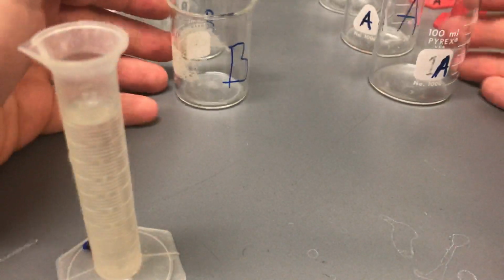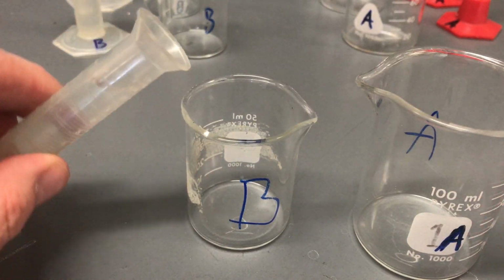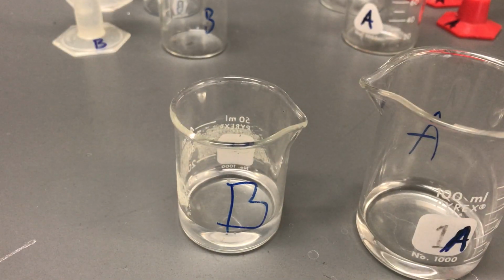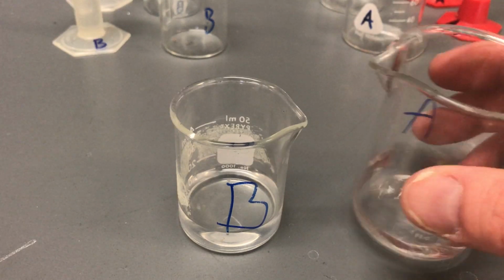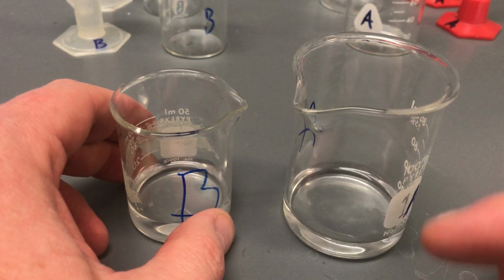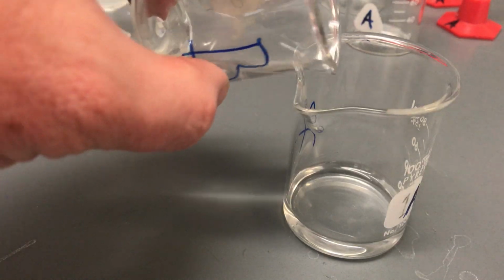And so we will bring those beakers in closer. I have my 10 and 10 now. So now this is, for example, an 80% solution over here because it was 8 milliliters of the solution and then 2 milliliters of water. So again, as soon as the liquid contacts, as soon as you see the first drops hitting in there, press start. As soon as you see the color change, press stop.